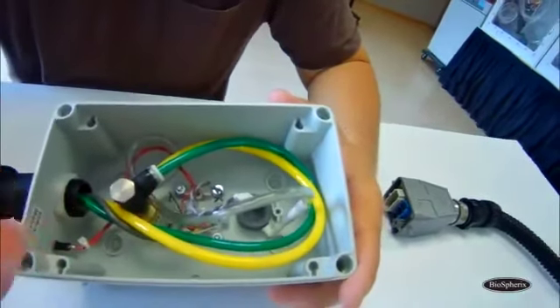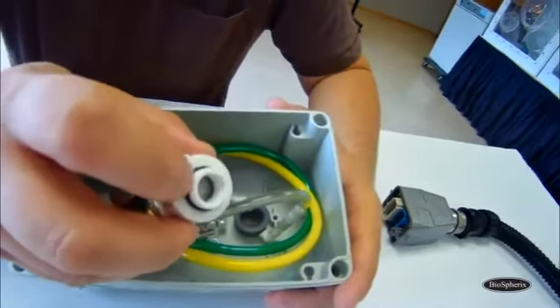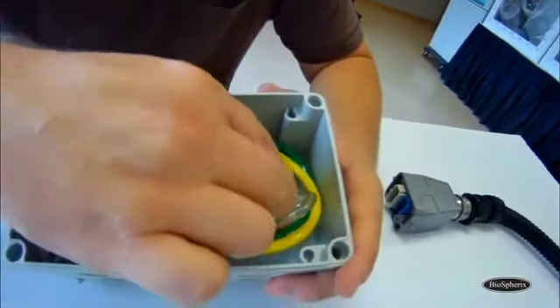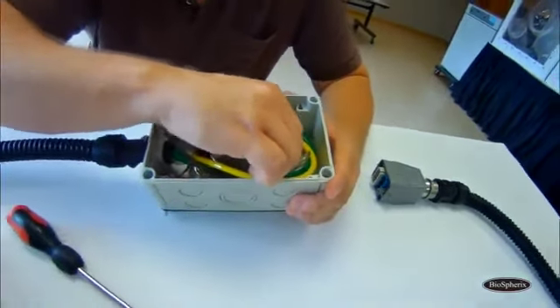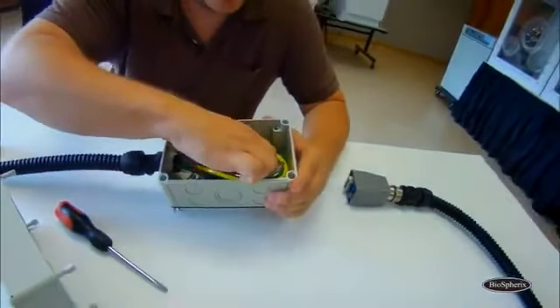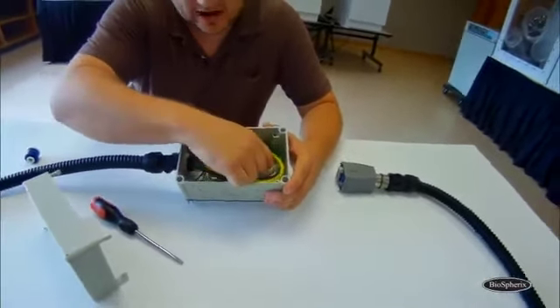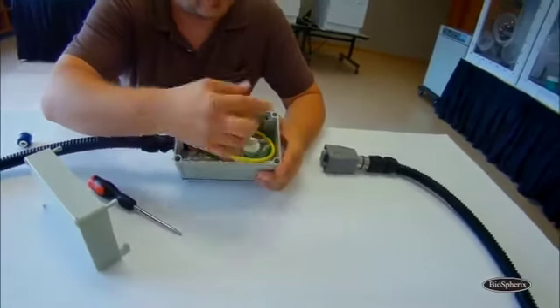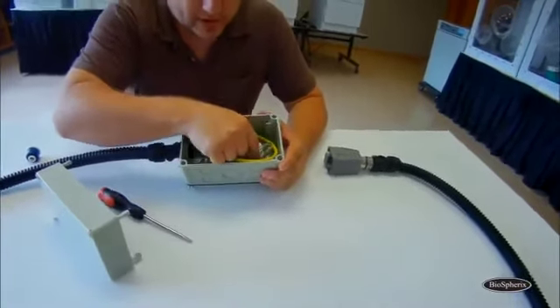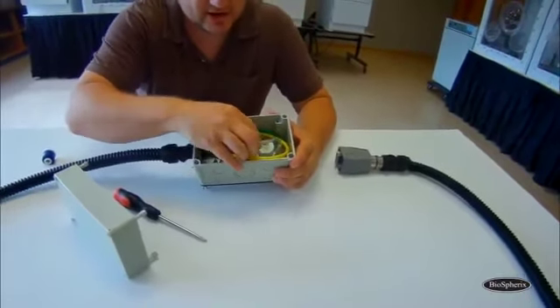The sensor only fits in one way, so you can take your replacement. You'll have a little black O-ring and some threads, and you just hand tighten it. You want to get it tight, but it doesn't need to be tightened to the point where you can't spin it. If I gave it a lot of force, I could turn it more. I don't need to go that far. So that's good enough. It's in there nice and snug.